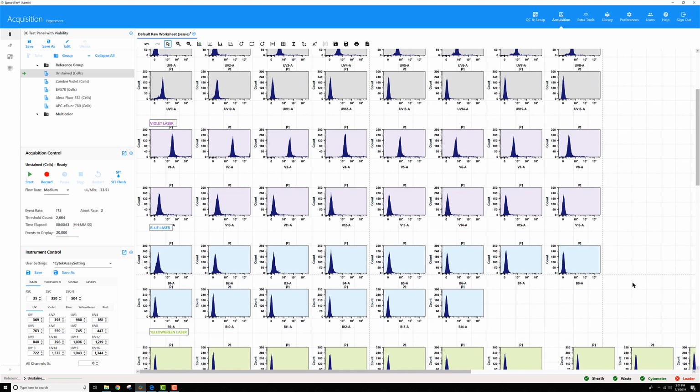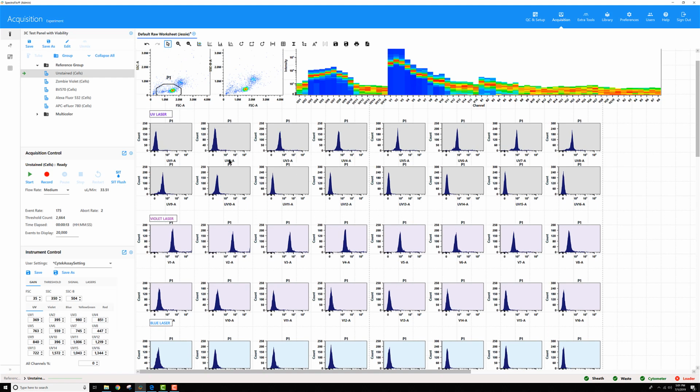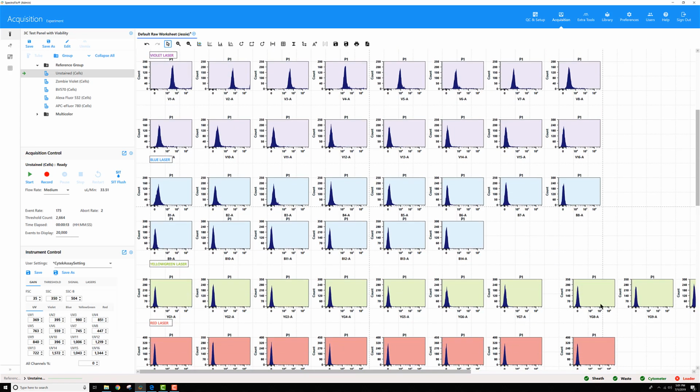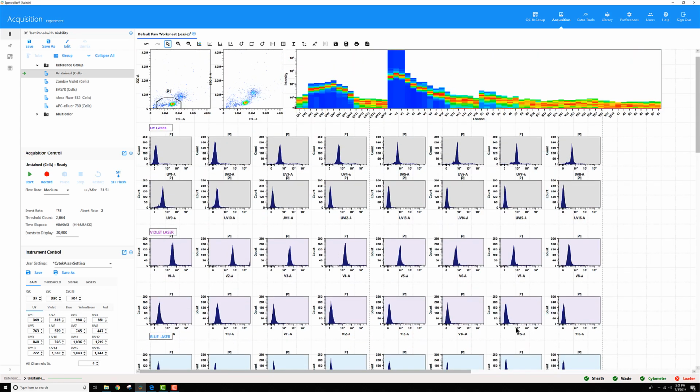Now for this particular dye that I'm looking at, this is a zombie violet live dead dye. When I look across all of the plots, it seems like in the UV scales, those positive events are well within the scale. But when I look at the violets, it looks like V1, V2, V3, V4, all the way up to maybe even V5 are off scale for this particular dye. Once I get to V6 onward, everything seems okay. Blue, everything's on scale. Yellow, green, everything's on scale. Red looks like there's no excitation, so everything's on scale there too.